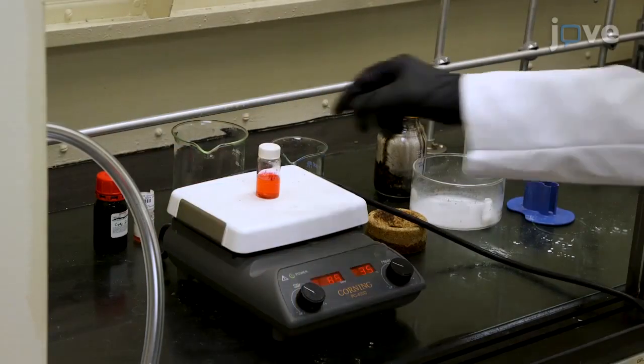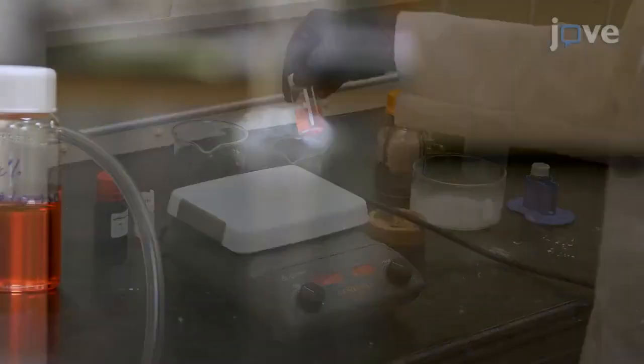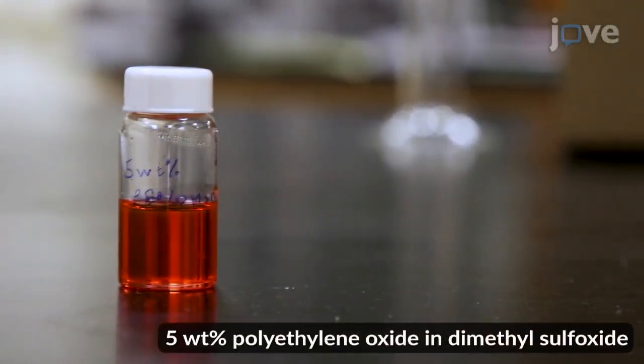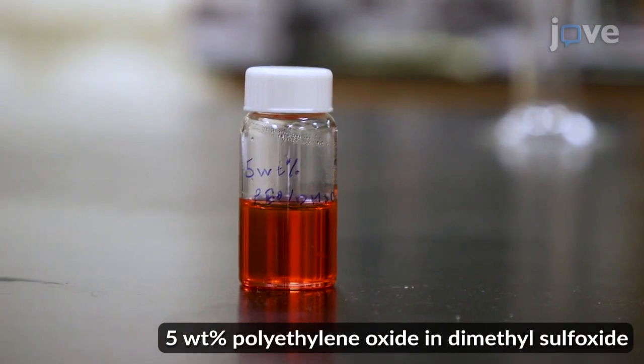Move on to get the material for testing. In this case, it is polyethylene oxide in DMSO, with red dye for demonstration.